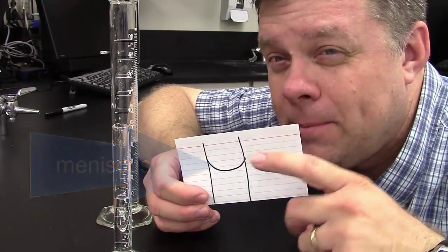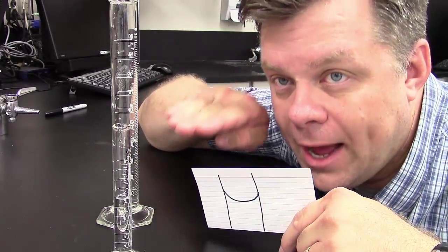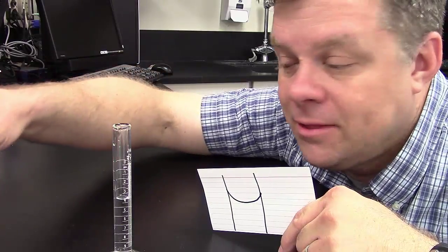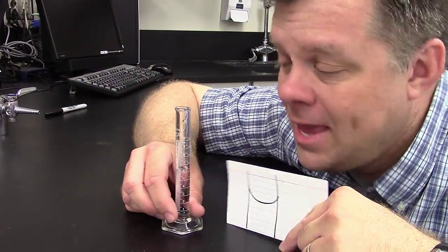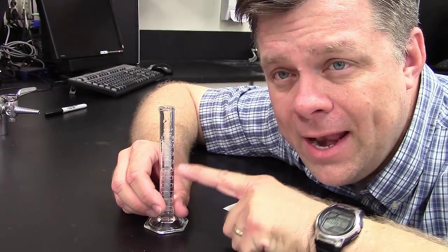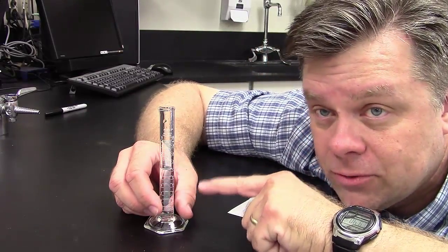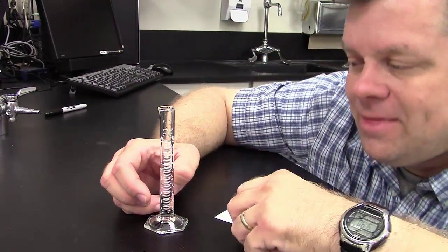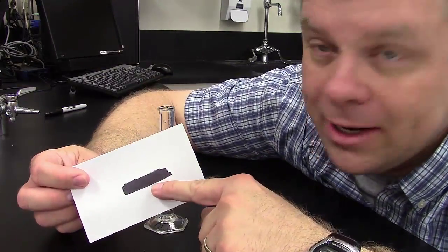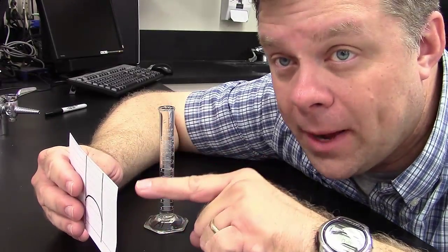So to be very precise, it's a good idea to get at eye level with the level of the particular liquid. So for instance, let's start down at this one, the small one. In this one, I don't know if you can barely see it, but the liquid's down here. Now, in order to be an accurate measurer, I have to get down at eye level with the liquid. But then, here's a little trick. If you take a piece of paper and you have a dark line behind it, it really helps to see where the bottom of the meniscus is.